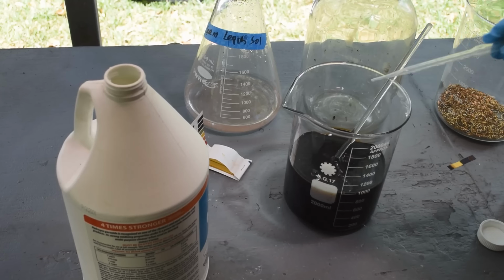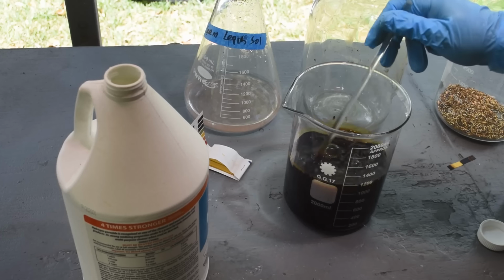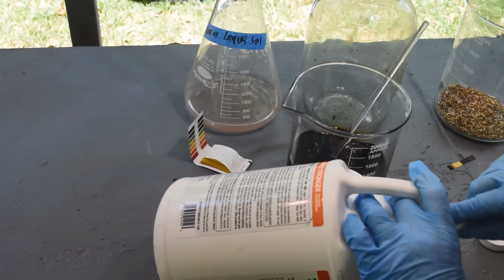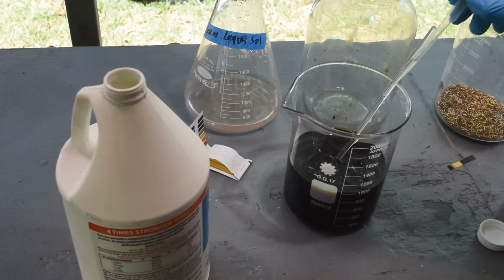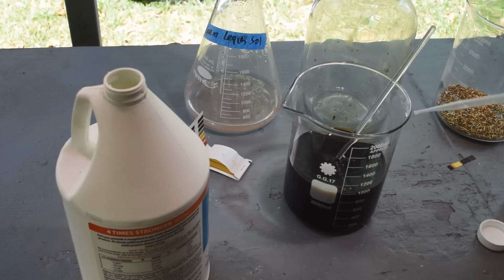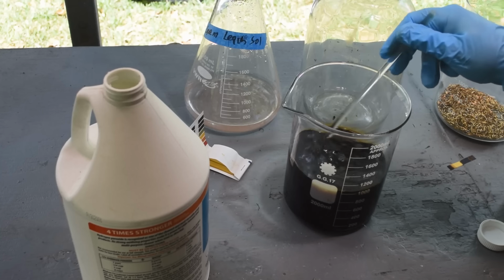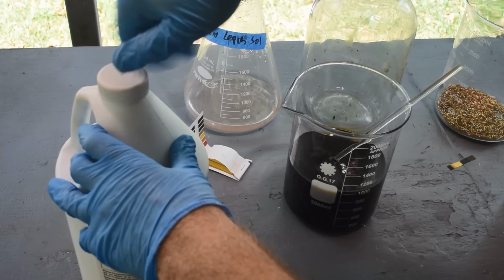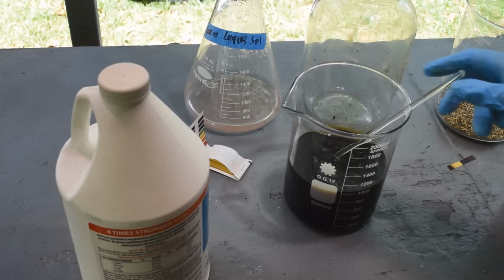It may not be acidic enough to free up a whole lot of iodine, but I do want to make sure we have, oh, I can smell it. I can smell iodine. Okay. So we have freed up iodine. We're getting iodine vapors wafting off of this stuff. So, okay, I'm not working in my fume hood. I'm outside, and the wind just blew a little bit of it towards me. So I would say we are probably good. There's free elemental iodine in here.